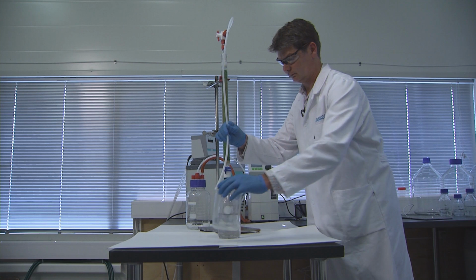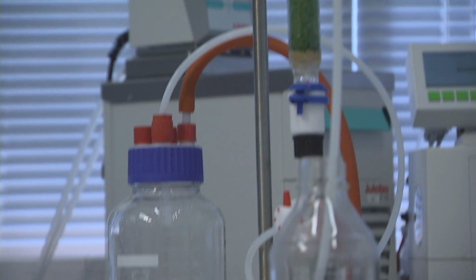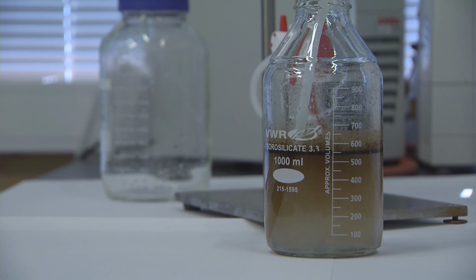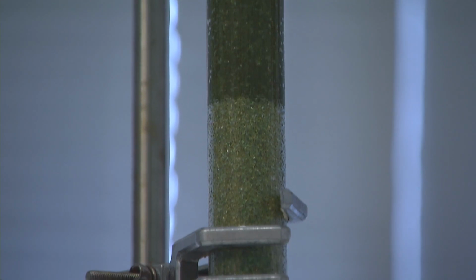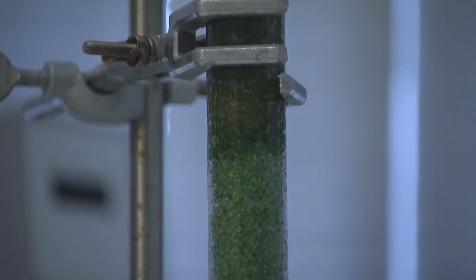SORBPOL is a glass-based depth filter. The activated surfaces work together with SORBFloc to capture the smallest of oil droplets and particles. In the laboratory, we show the filtration efficiency in a column filled with this media. We apply it to our intensely remixed SORBFloc treated emulsion with a full 10,000 ppm of oil.